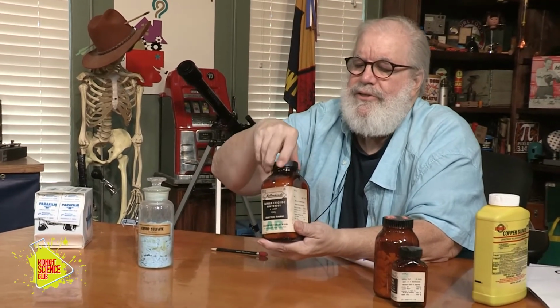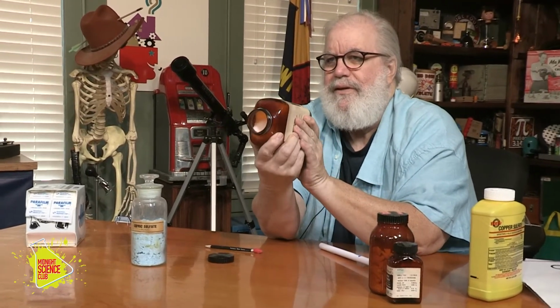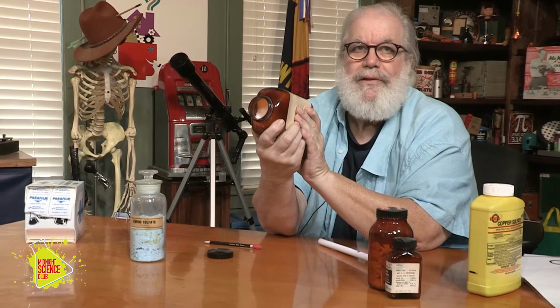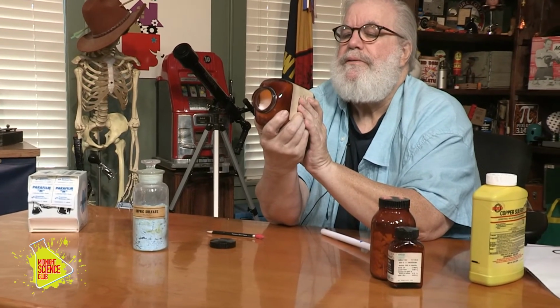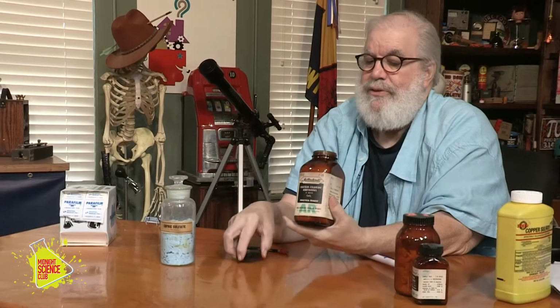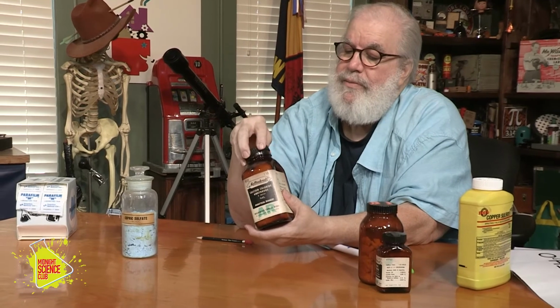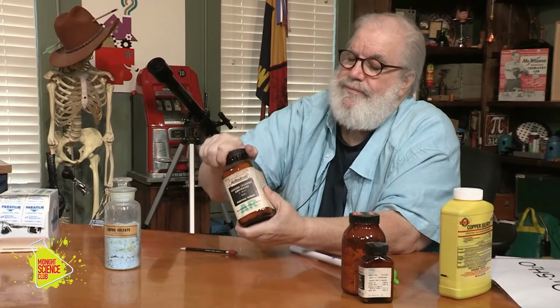Well, when I unscrewed the lid, this had been sitting so long, I was going to pour some out. They're in there, but some water from the atmosphere leaked in. This is all hydrated now. It's no longer anhydrous. It's turned into kind of a lump in there. So I would have to take this out and treat it to get rid of the water and dehydrate it again. It says on the label it's anhydrous, without water, but leaky lid. I should have sealed it up with some parafilm or something. This has been sitting on the shelf for a long time, so it leaked enough moisture in there to hydrate it again.